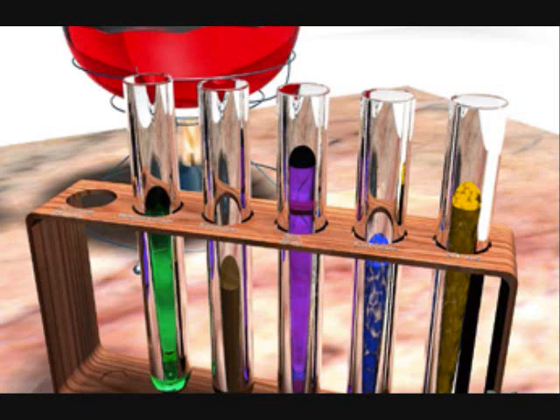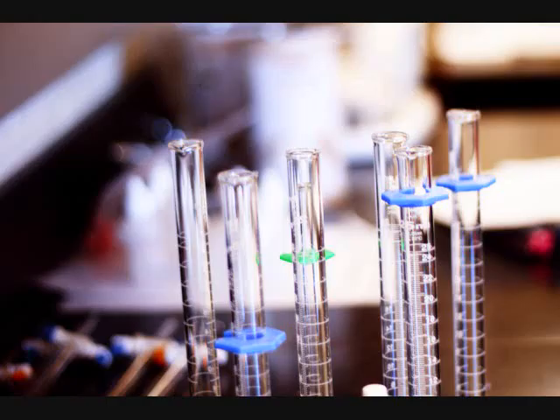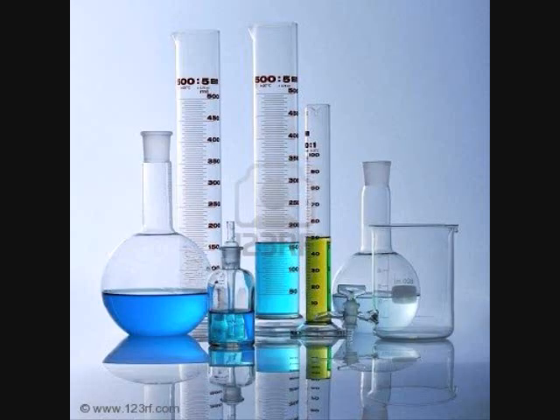Our independent variable in our experiment is the amount of our substance we will use and how diluted the substance will be that we put in the cuvette. Our dependent variable is the absorbance that each of our cuvette substances records. One control that we have is our first cuvette will be distilled water to calibrate the colorimeter.